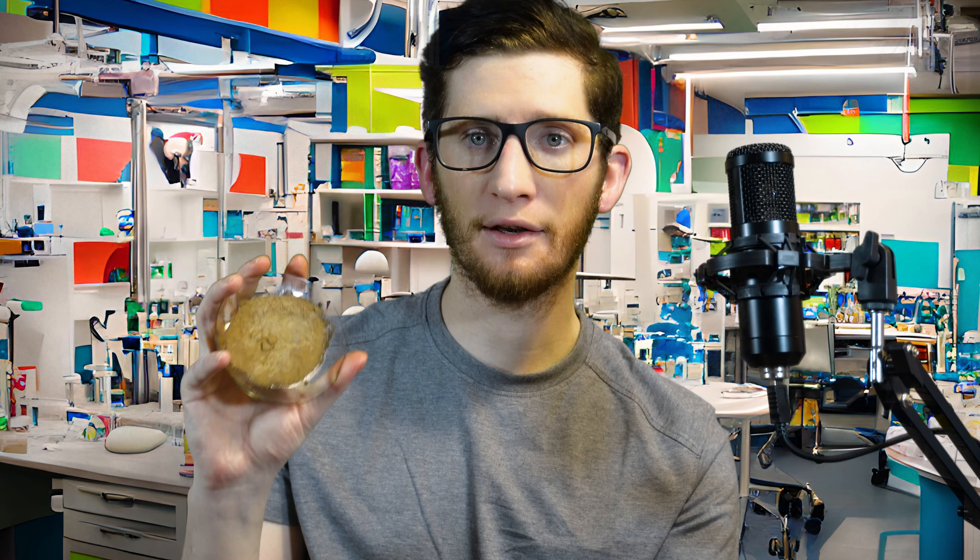We got a total yield of about 8 grams, which is actually decent considering I wasted half of it trying to extract it out of the water mix in the last step. Here's some of it drying — I had to try a bunch of different methods. What I found was the best method was to chill the whole thing overnight and let it settle at the bottom, then decant off the water, filter the rest, spread it out, and dry it. That was one problem, but the major problem was in either the bromination or the sodium hydroxide addition — things were just tarring up and never coming back, and it happened so many times.